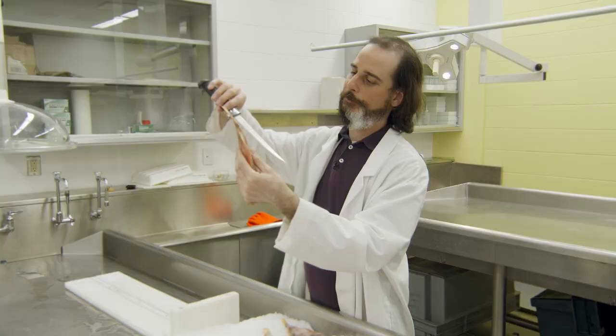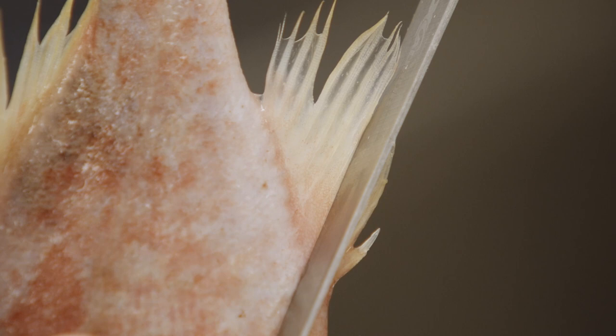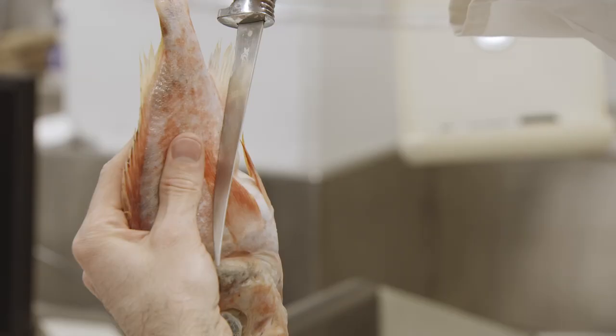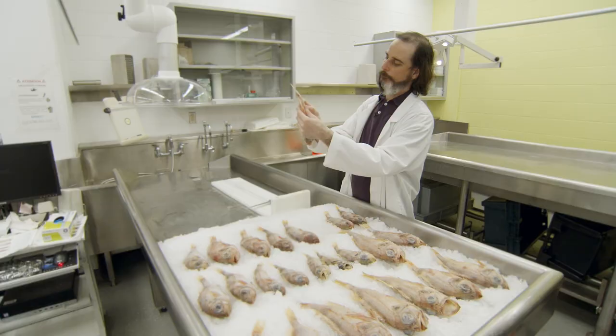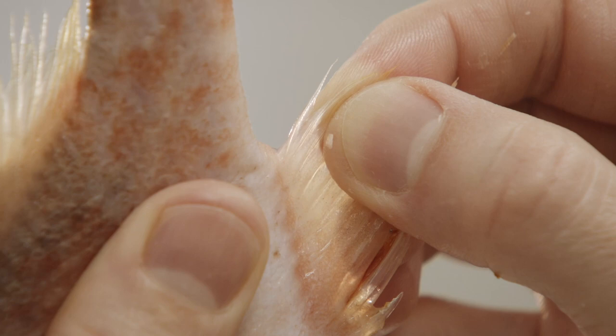A good trick is to use the blade of a knife. You just set it on the third spine so you can pull on the anal fin to deploy it, and use the blade to hide the spines so you can count the rays that follow without counting a spine by mistake. It is very important to count the rays at the base of the fin, near the belly of the fish. Several rays will branch off, having one insertion and multiple tips — this is what we call bifid rays. What is important for us is the number of insertions, and this is what we need to count.